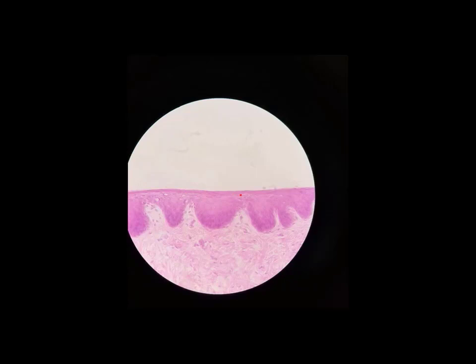So this is that stratified squamous epithelium. Now, there is a part of this that doesn't really look completely flat, and that's deeper down here. And really, these are cuboidal cells, and they're special. They're stem cells that are actually dividing to produce all of these cells at the top. So really, the cells at the top, that is the stratified squamous epithelium.